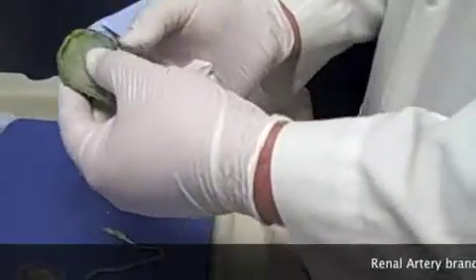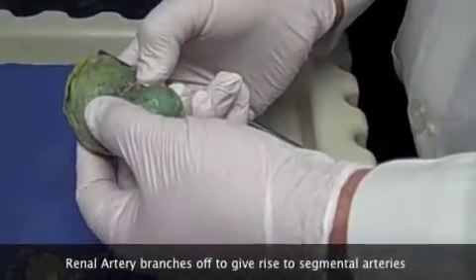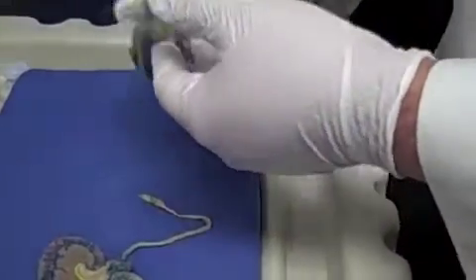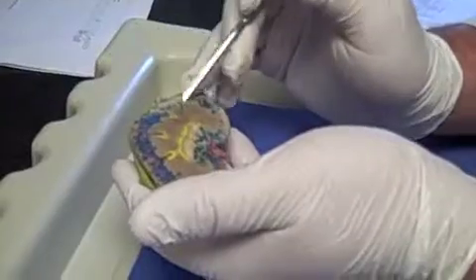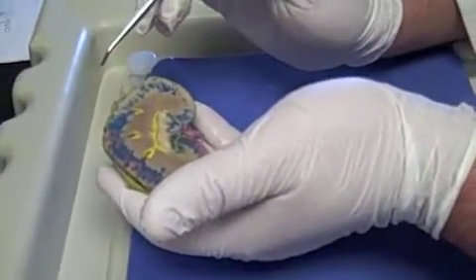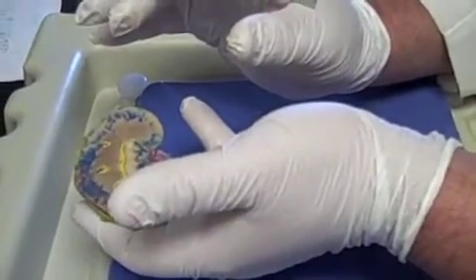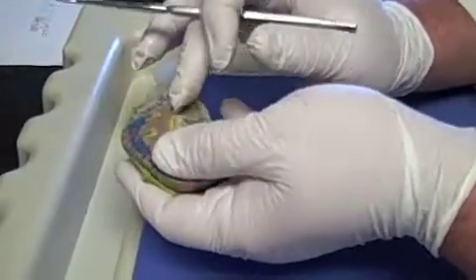Do you remember us talking about how the renal artery right there starts to branch off before it even comes into the kidney to give us segmental arteries right there and right there? Okay? If we flip this over and look here on the inside, you guys can see where those arteries are going. Well, the segmental arteries are going to give rise to arteries called lobar arteries. Lobar arteries, you guys can't see on here without basically ripping the kidney apart. Okay? So, those aren't on here, because I can't test you on those.